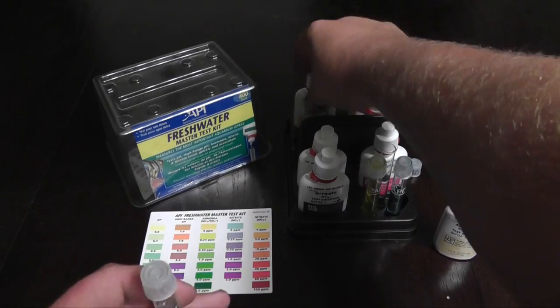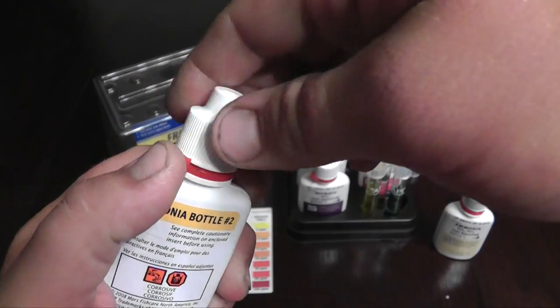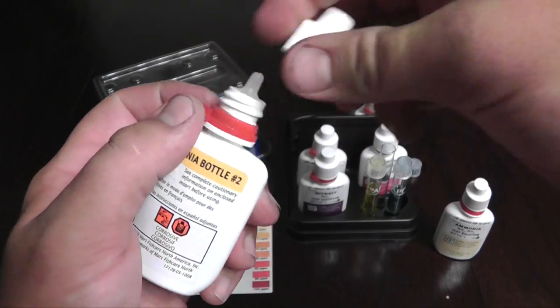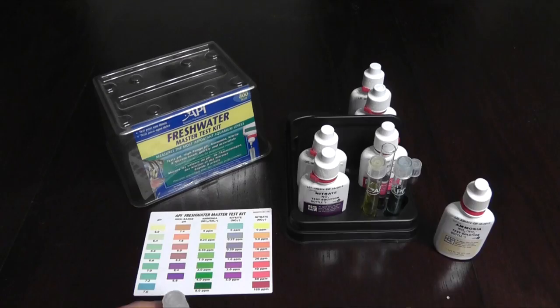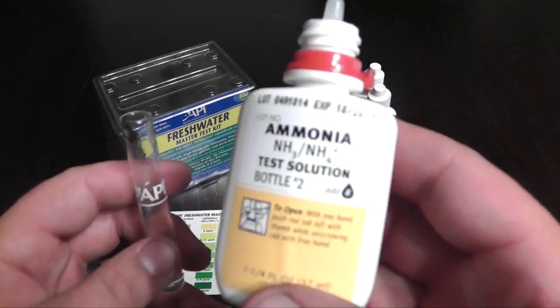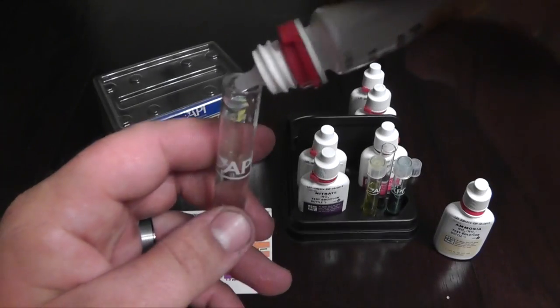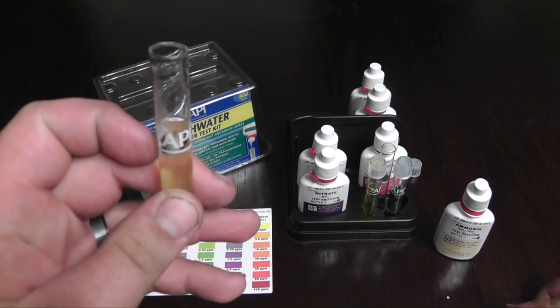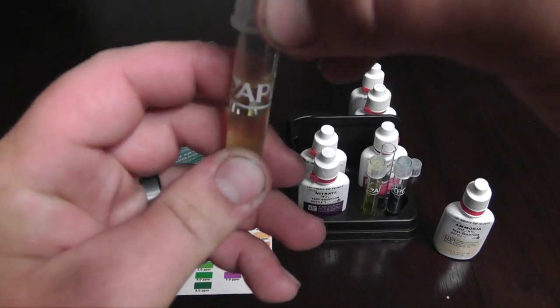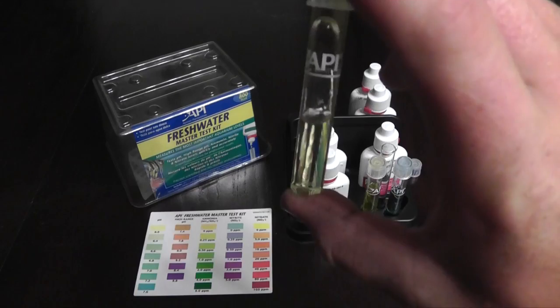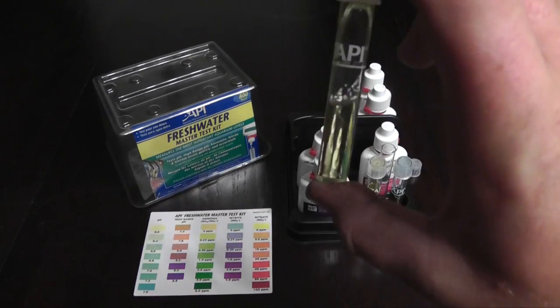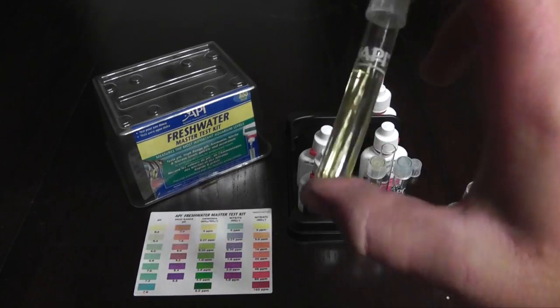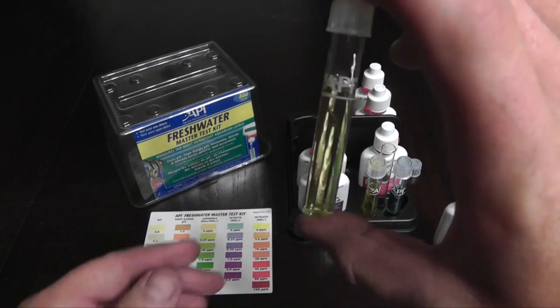And then you're going to add eight drops of this solution. So one, two, three, four, five, six, seven, eight. That one dropped out kind of fast. That's okay. So I'm going to tip it. Now you tip this because that's what the instruction manual says to do. So that's what I do. And then you let this one sit.